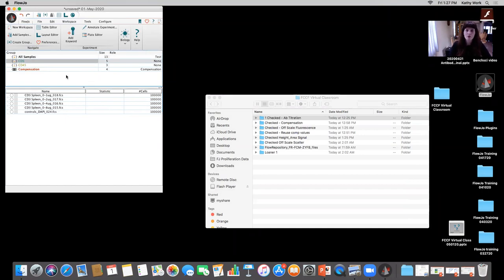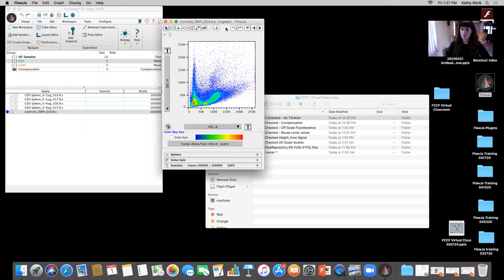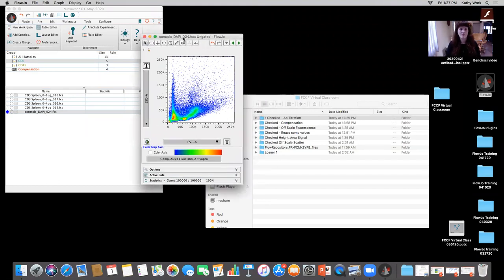Okay, so for anyone that was with us for our first session, we went over how to titrate antibody and how to analyze that data in FlowJo. I'm gonna show you a little bit of a better trick for that today, and then we're also gonna analyze that data. So I'm gonna go ahead and open up a question or, okay, maybe just unmute for a second.